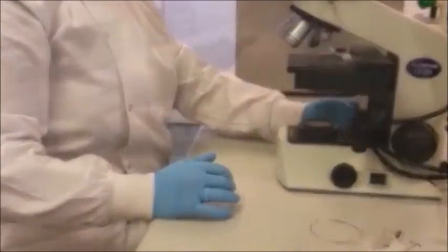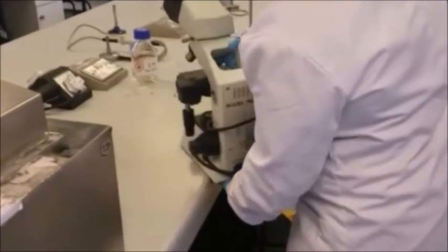Make sure by storing the microscope that the arm is facing outwards.